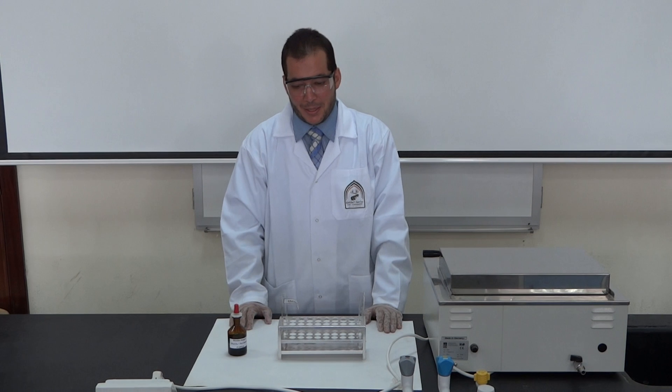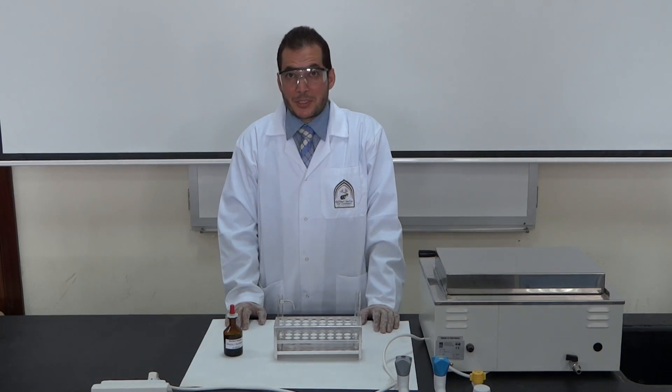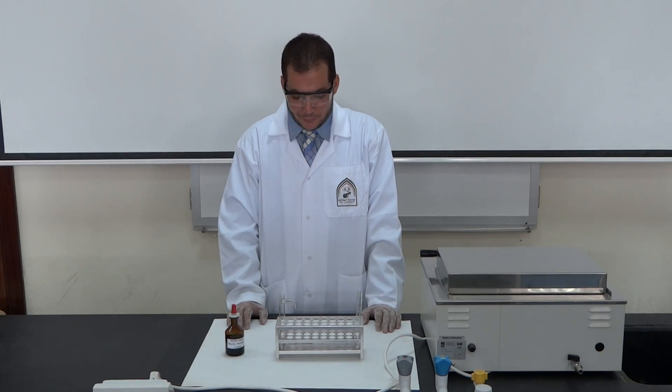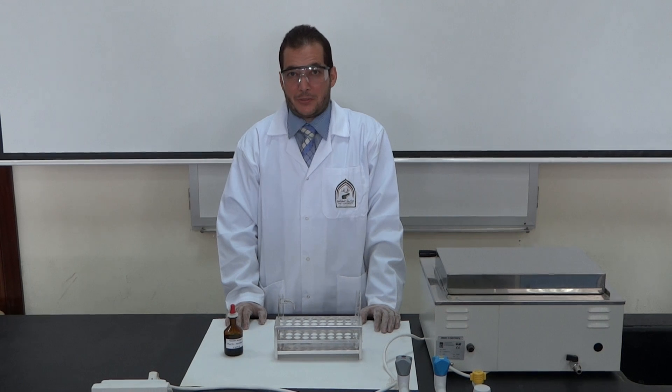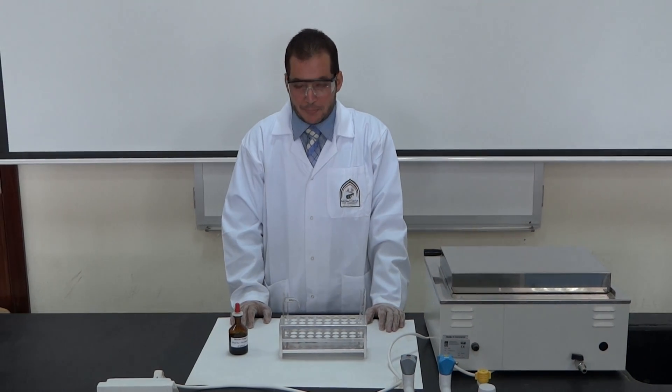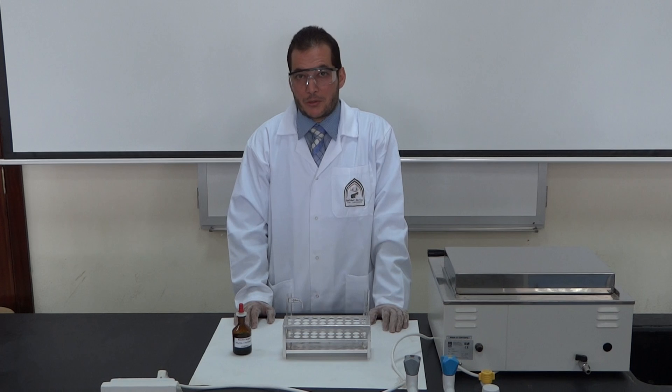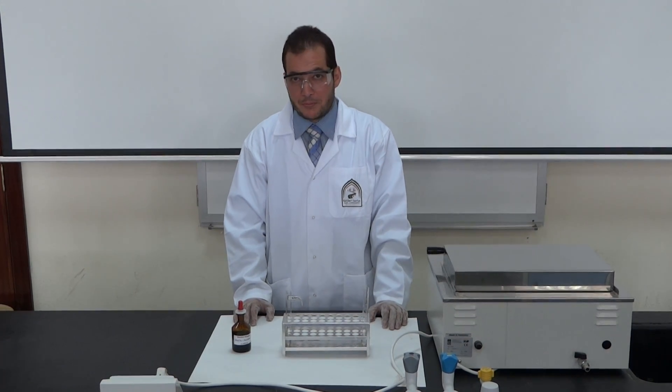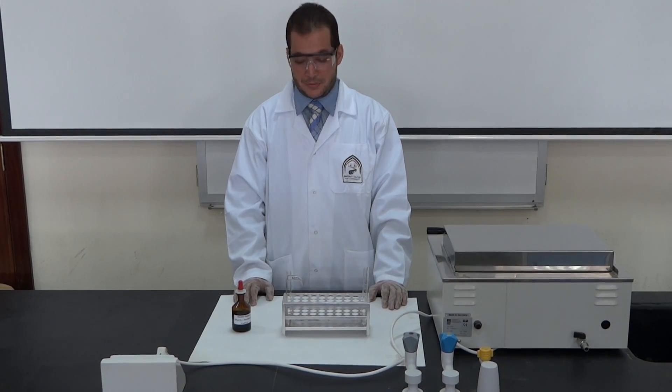Benedict test. Benedict test is for reducing sugars. We have different tests for reducing sugars such as Benedict, Fehling, and Tollens. Now we're going to do Benedict. It's a very simple test.